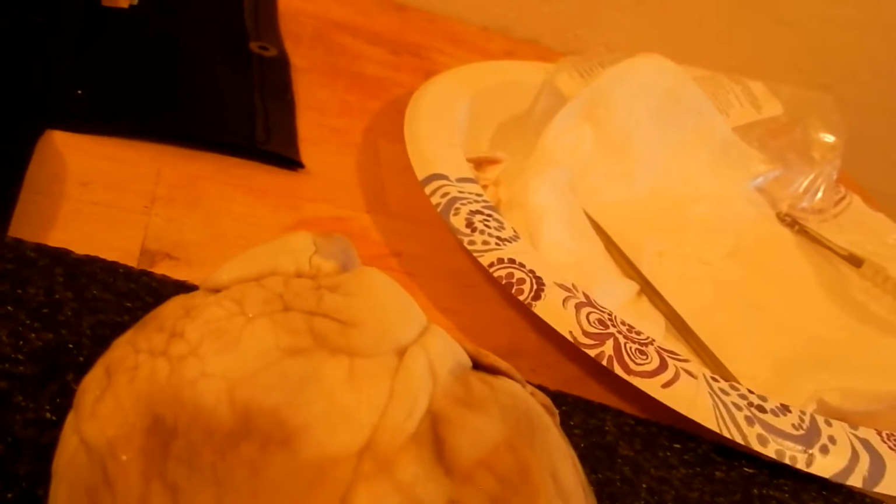Alrighty, next, if you can see here, we have the interventricular sulcus of the heart. You can also see here, we'll go to the posterior view as well. So earlier we talked about the aorta, the brachiocephalic artery.